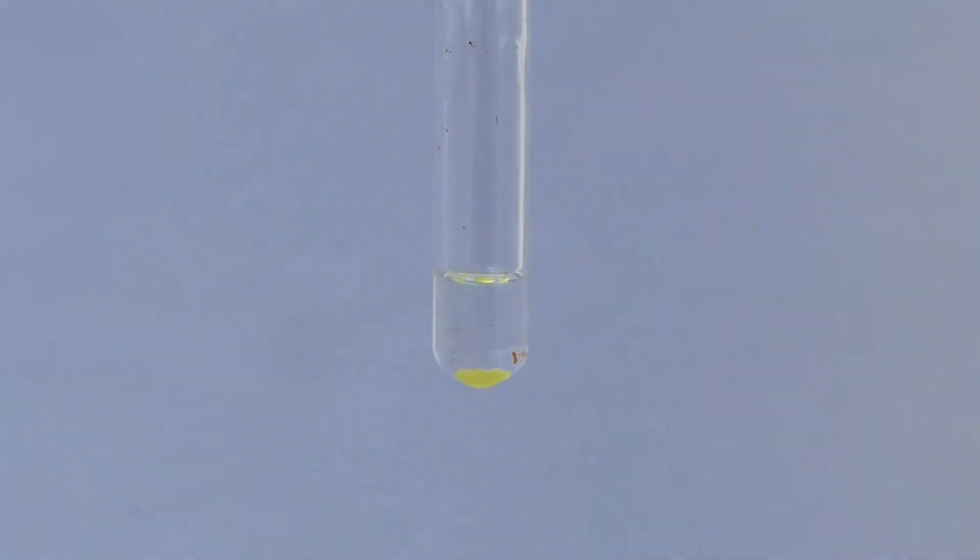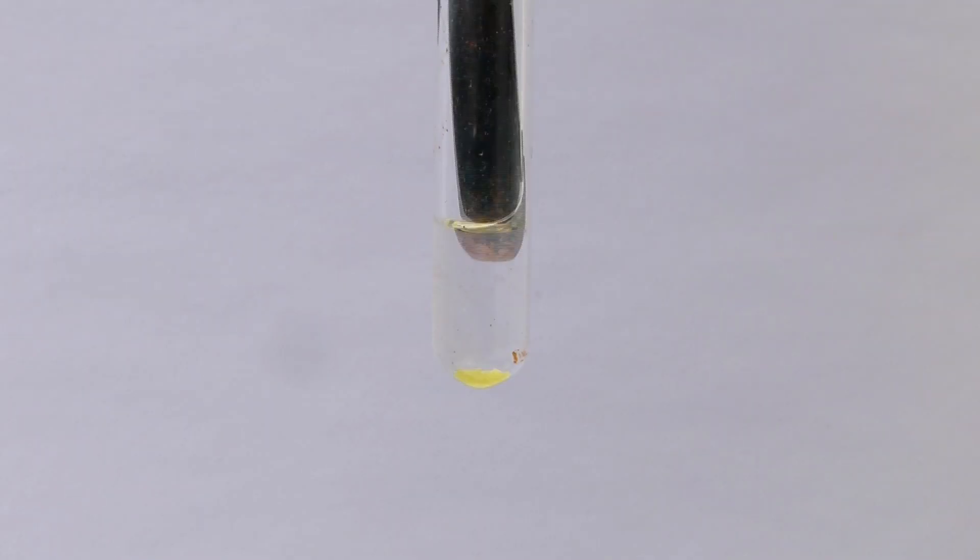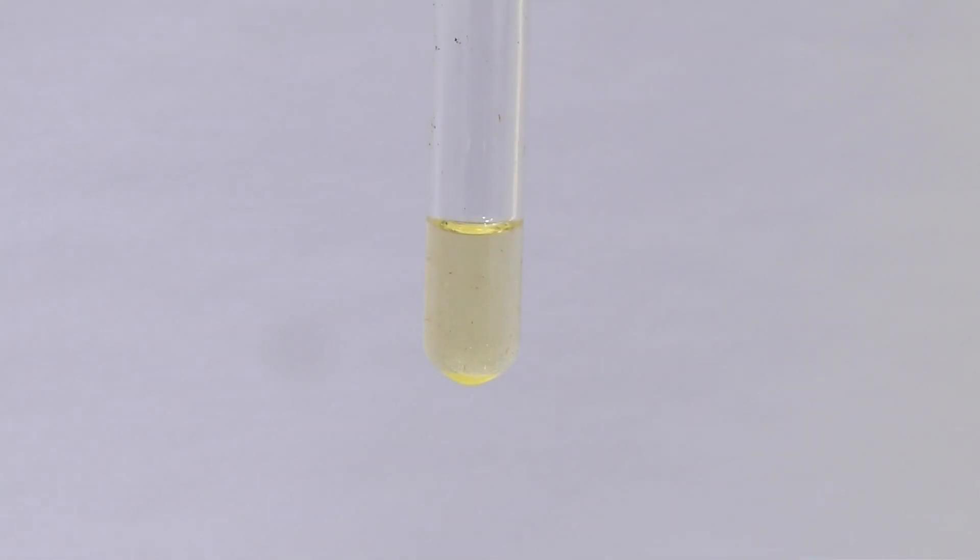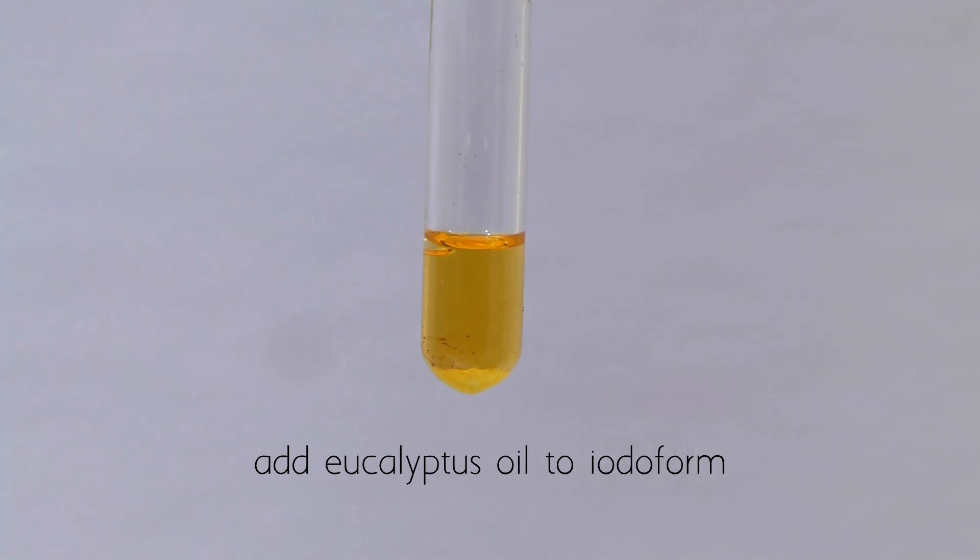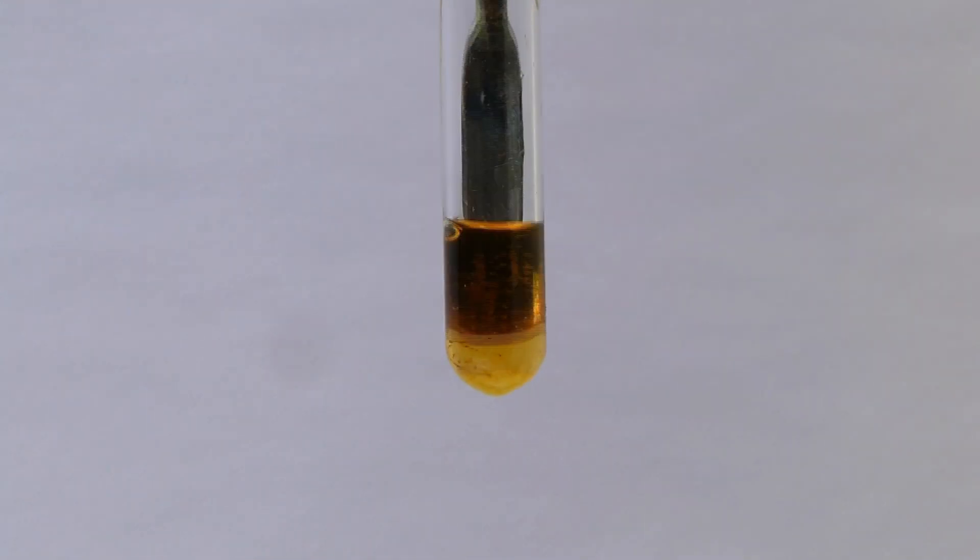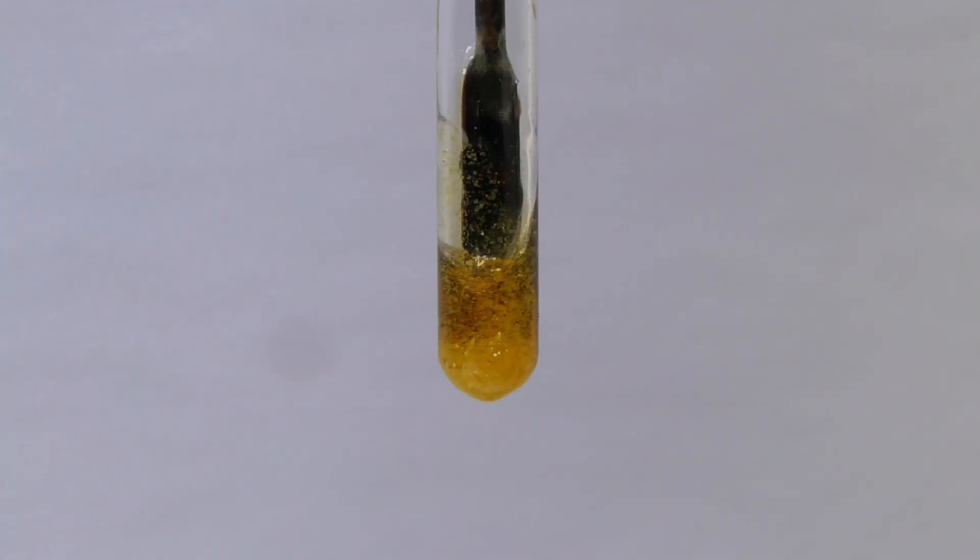Solubility in ethanol is not as good as you might think. It does dissolve though, but it takes quite a while. Of course, it is completely insoluble in water, but just for fun, I tried dissolving it in eucalyptus oil, which I think worked even better than dissolving it in ethanol.